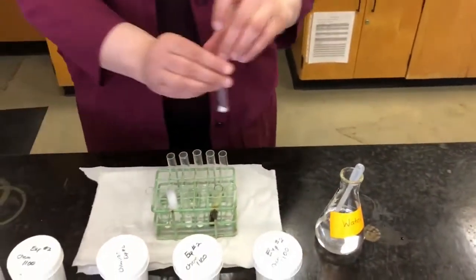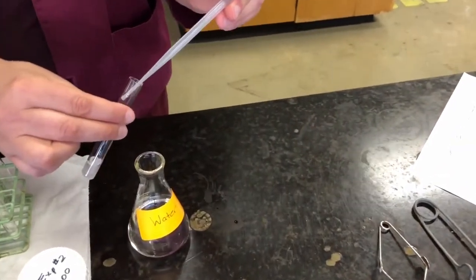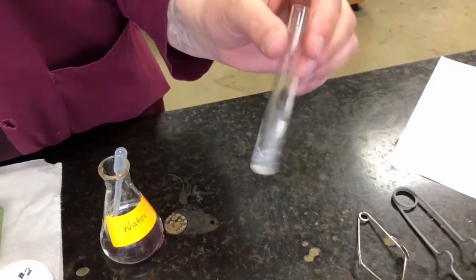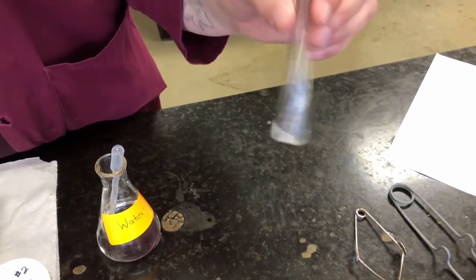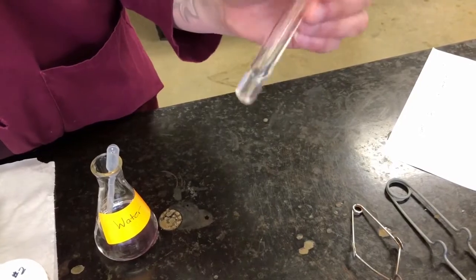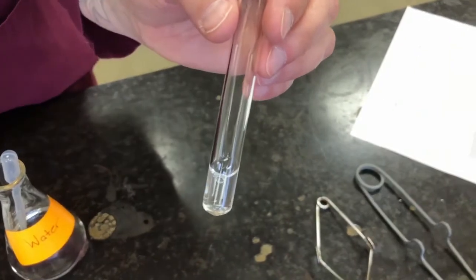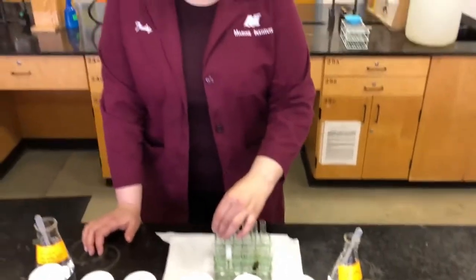And finally, we have washing soda, also used for washing or cleaning, so we would maybe predict that it's soluble in water. Shake it again. You can see that it is mostly dissolving. Just a couple particles there on the bottom. There you go, it's dissolved. So washing soda, again, is soluble. So of our 6 compounds, 5 were soluble. The only one that was insoluble was chalk.